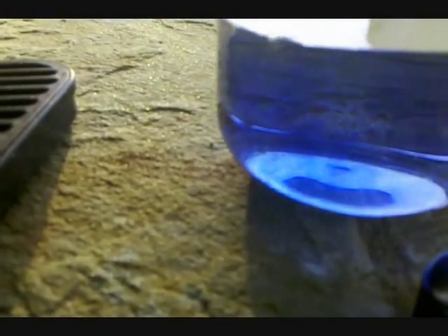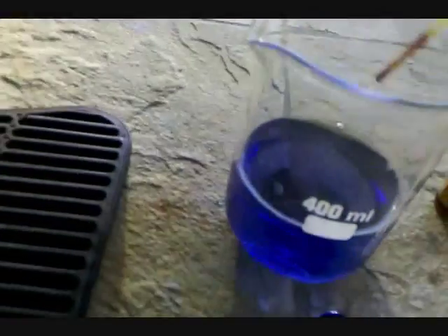Look at that color. I don't know how well it picks up on camera, but it's pretty intense in person.